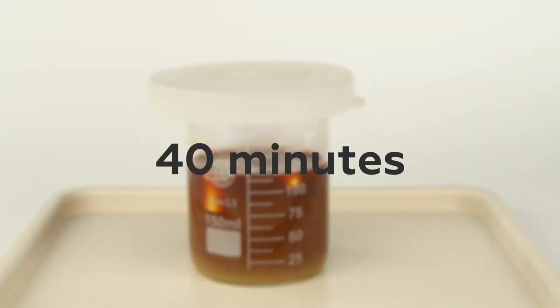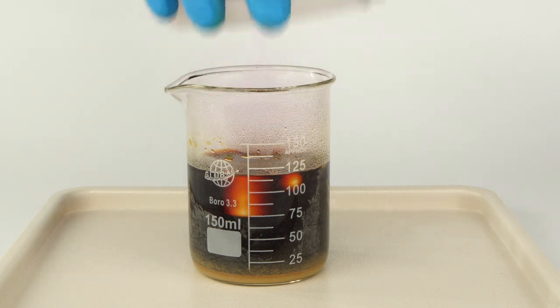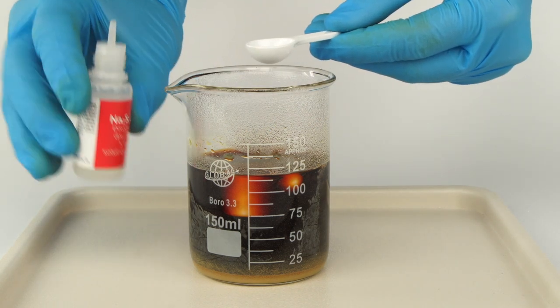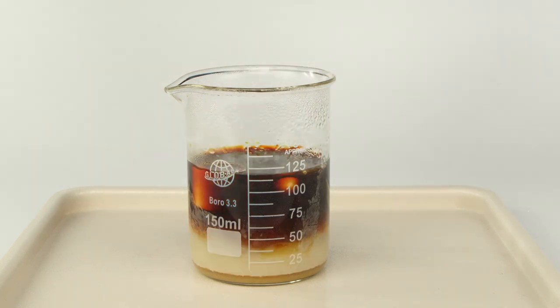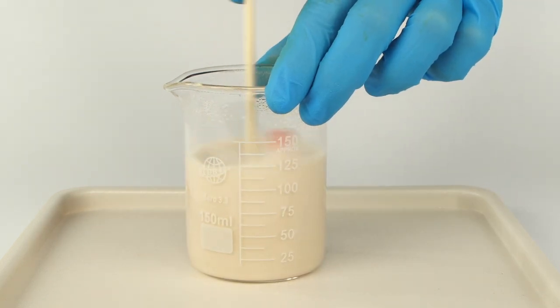Wait 40 minutes, then remove the lid and add one big spoon of disodium disulfite. Mix 10 seconds using the wooden stick.